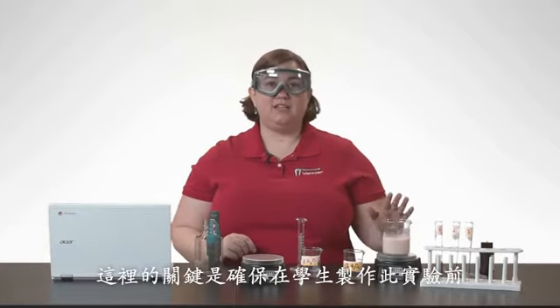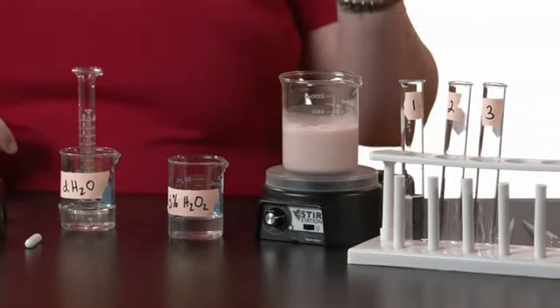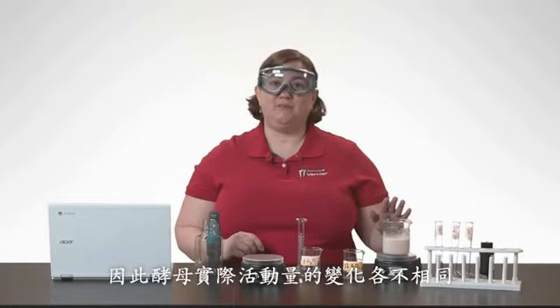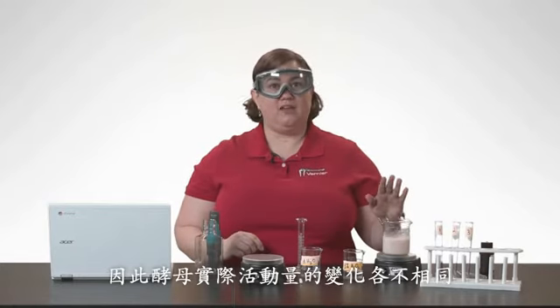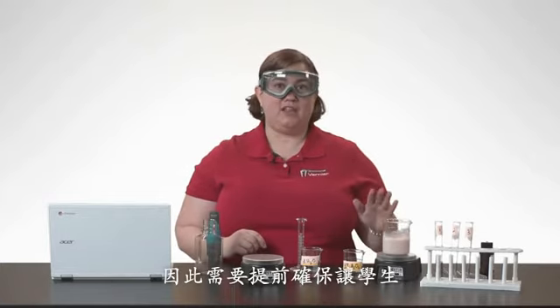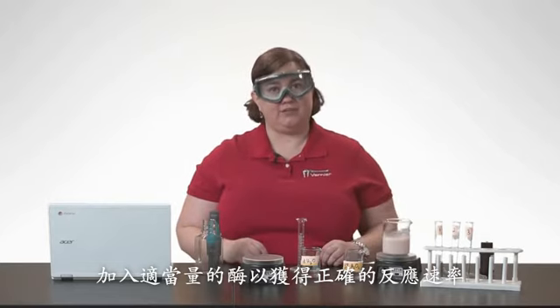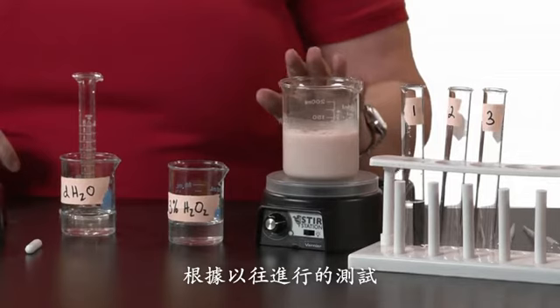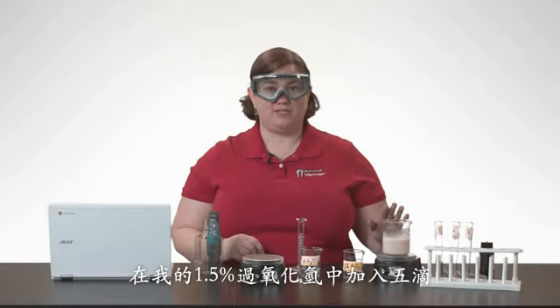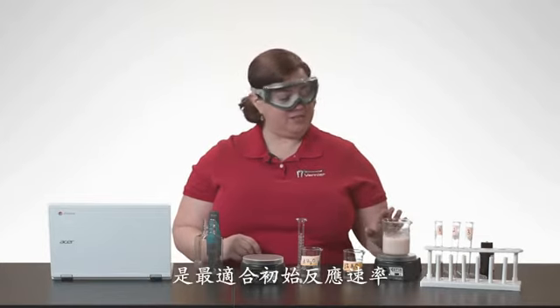The key here is to make sure you test your enzyme before your students do this experiment. Since we are using yeast as our enzyme source, the yeast can actually be quite variable in the amount of activity they can have. So you want to make sure ahead of time that you have your students adding the appropriate amount of enzyme to get the correct reaction rate. Since I tested this previously, I know that adding 5 drops to my 1.5% hydrogen peroxide solution is the appropriate amount for my initial reaction rate.